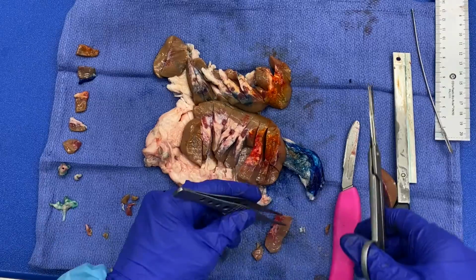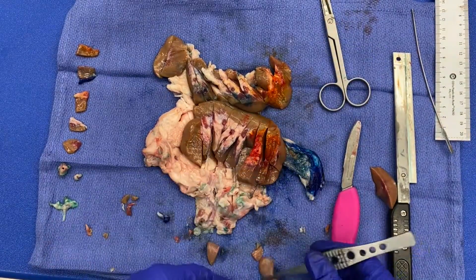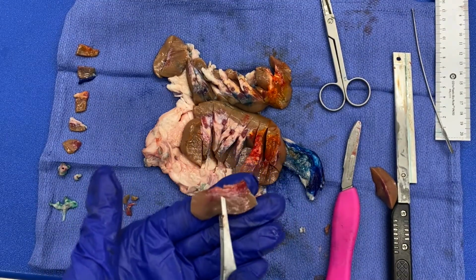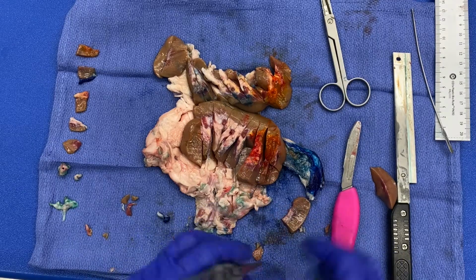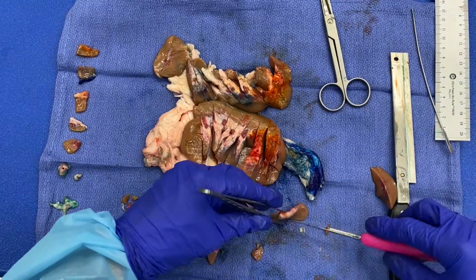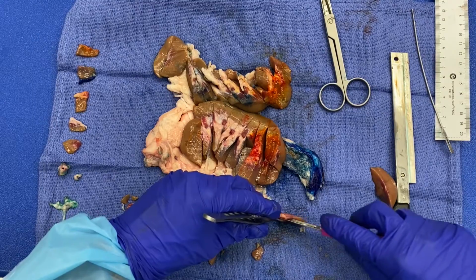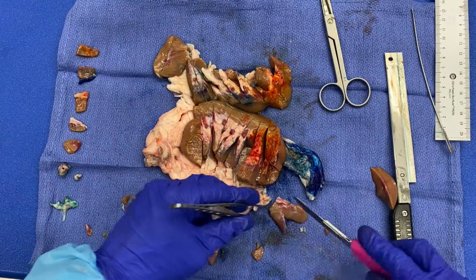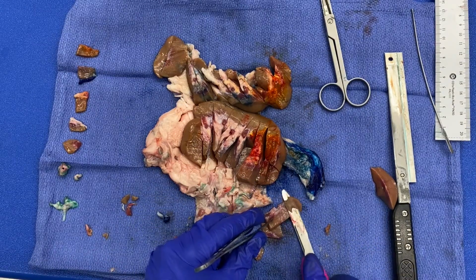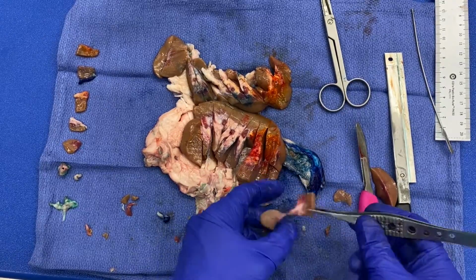So again, just kind of lay it down, determine what side you want to go in the cassette. I want the side that is over here with my tumor and renal sinus fat. I want that to go down in the cassette, so then I will trim the opposite side. Let's see, I haven't done this way in a minute. I can hold it up and cut down. That's one way to trim it. Again, or you can go back, leave it flat. Okay, so again, nice size.